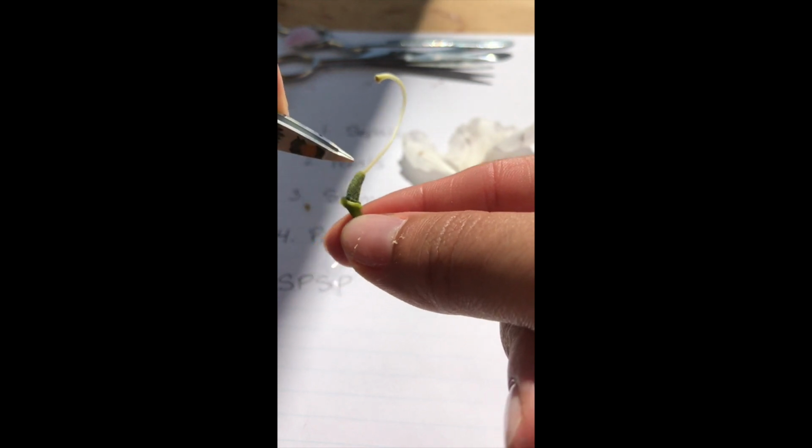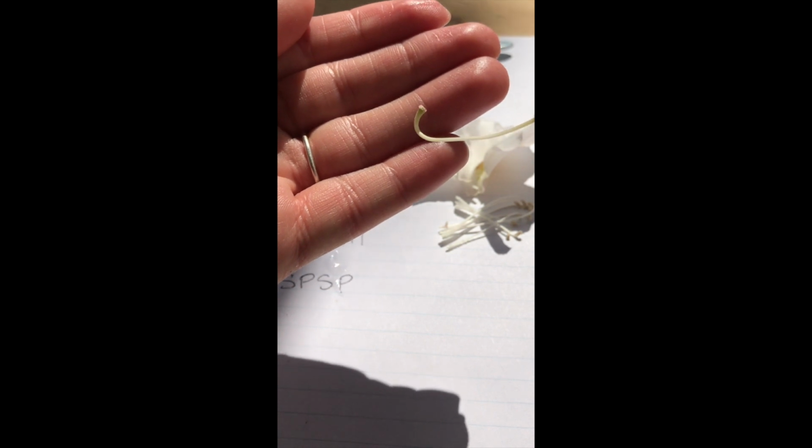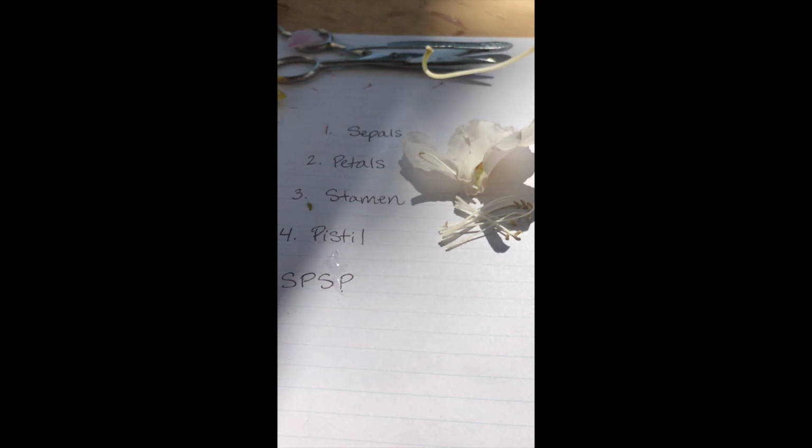The base of the pistil on this flower is really dark green, and then the rest of the pistil curves up. But you might be able to notice that right on the end of that pistil, if I can get it to focus, is again that kind of shape that we saw in the last flower, almost like a little mushroom top or a little suction cup, a little landing platform for that pollen to touch on.